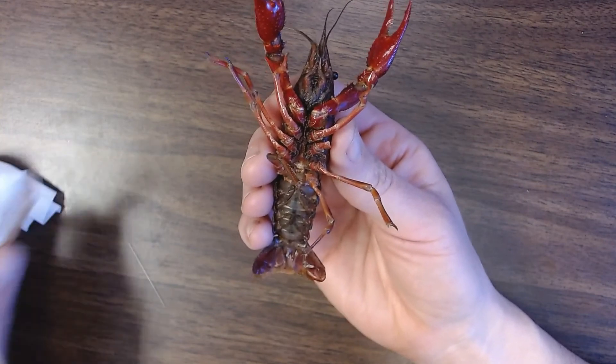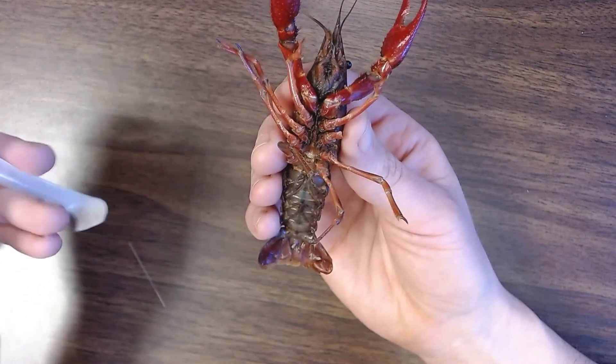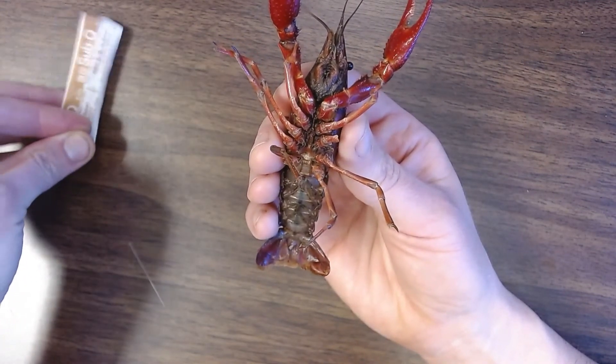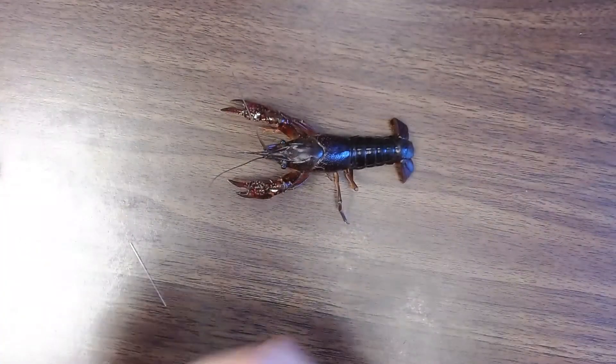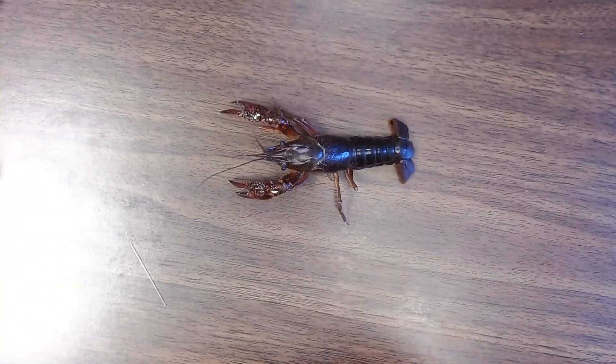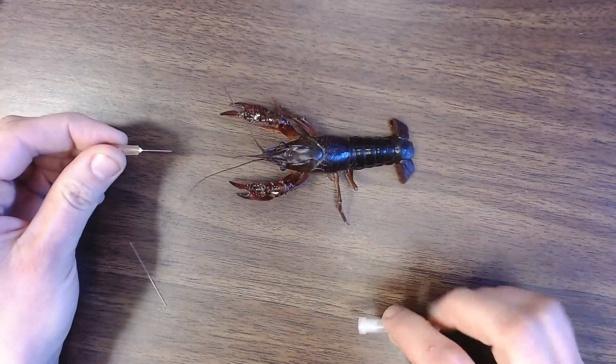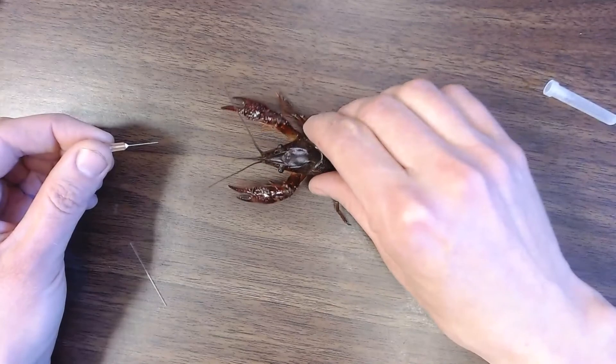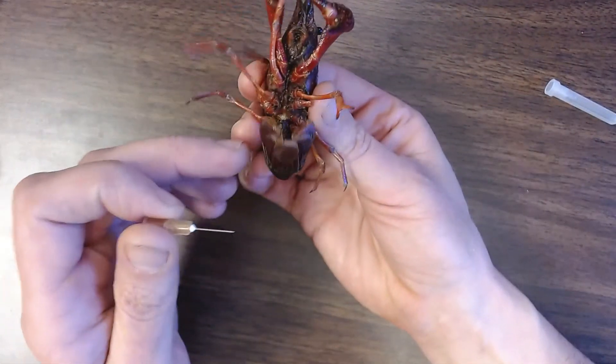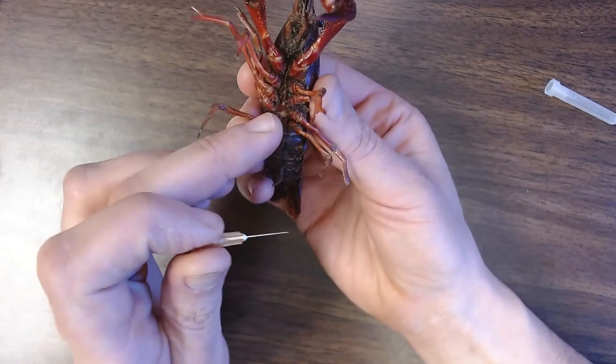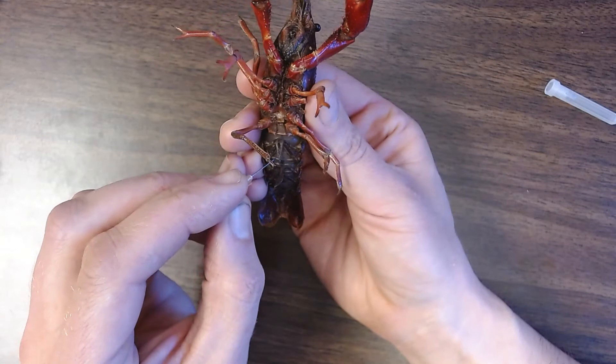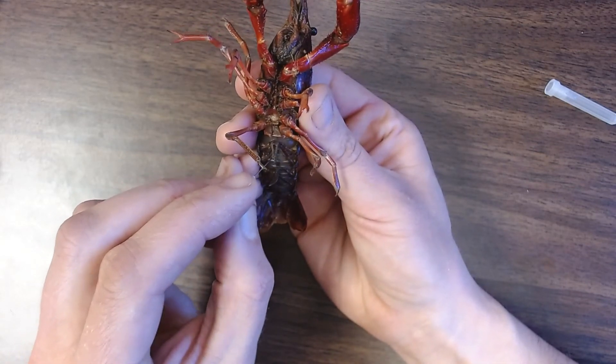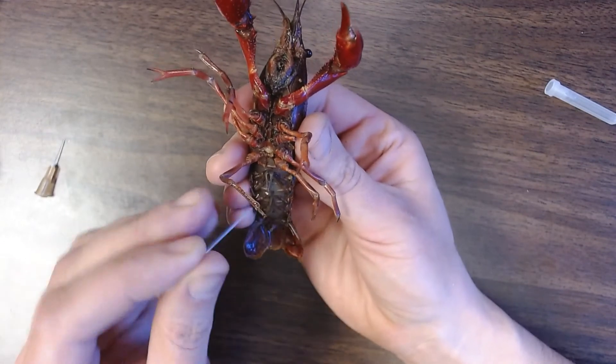So here's my crayfish. I am going to and at this point I've actually blotted this crayfish off so its underside is dry. If you don't do that oftentimes when you try to sample the hemolymph the blood will not pool in a way where it's easy to get. And I've got a little 26 gauge needle here. So then on the underside sometimes your crayfish may kind of tuck its tail up so you just want to hold the tail back.